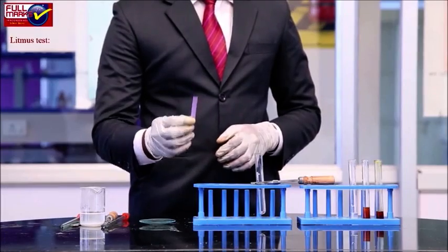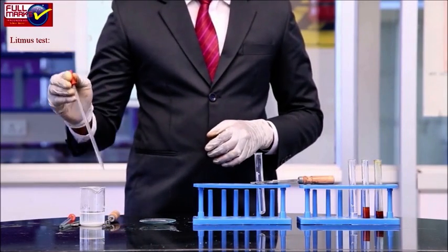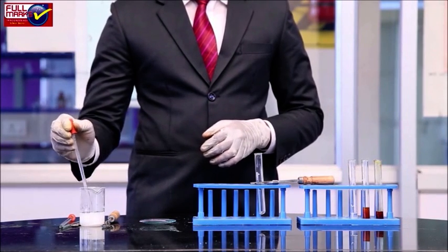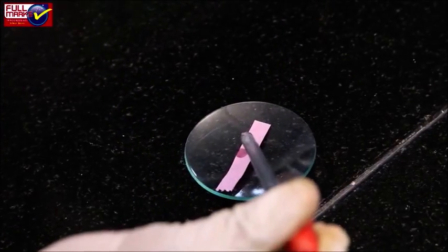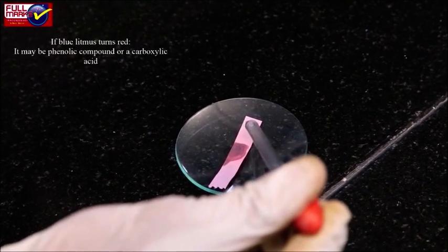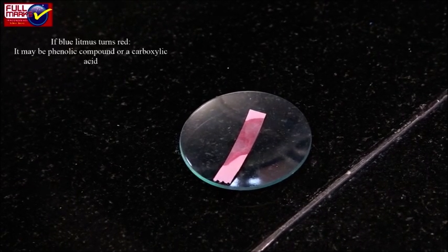Litmus test. Take a blue litmus paper and add 1 drop of organic liquid on it using a dropper. If blue litmus turns red, it may be a phenolic compound or a carboxylic acid.